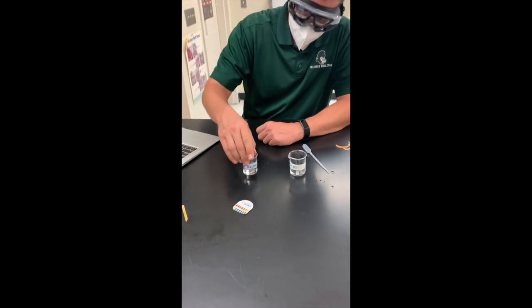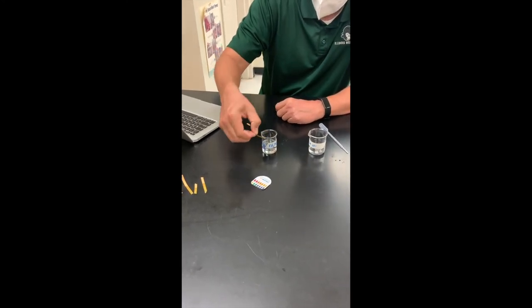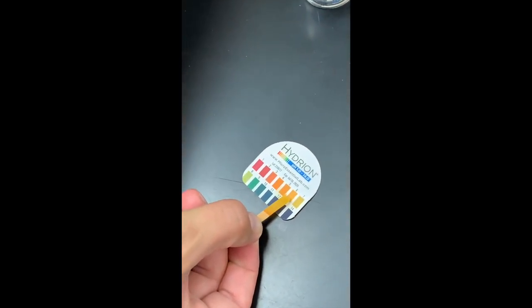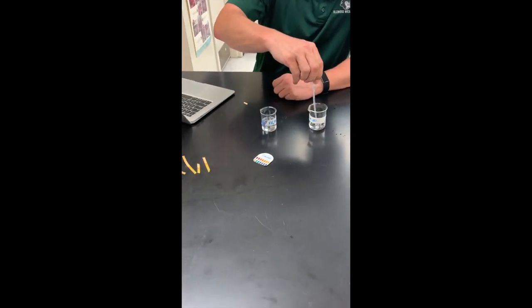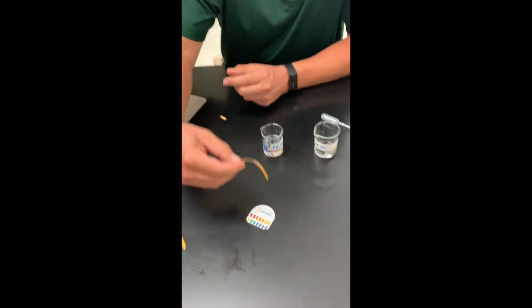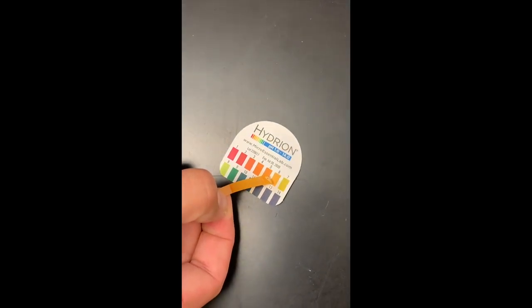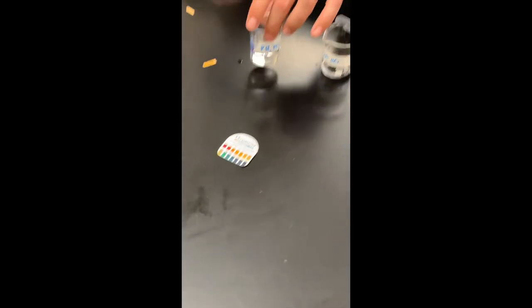Another milliliter added, swirling up real good — check — six, I think. That's a six. So that's after four milliliters. We've got one more milliliter to add — swirl and one last check. Maybe a five and a half. All right, so that was our experiment with hydrochloric acid and our potassium dihydrogen phosphate buffer.